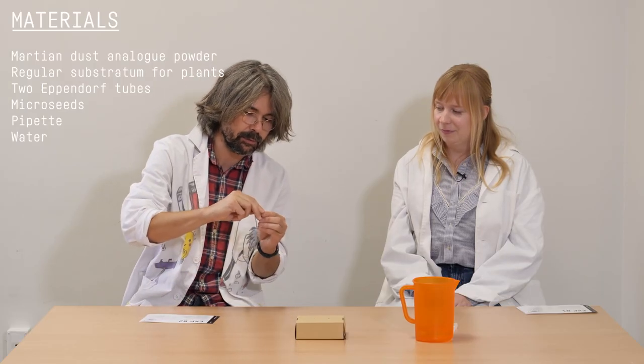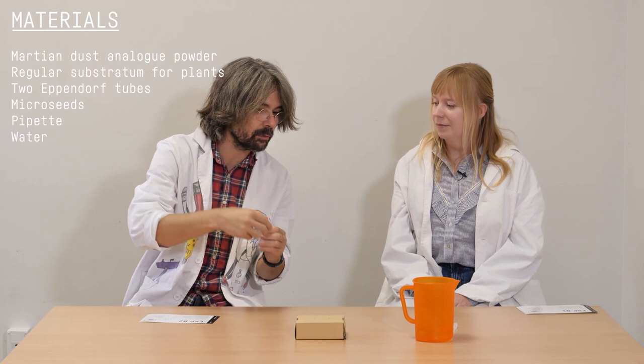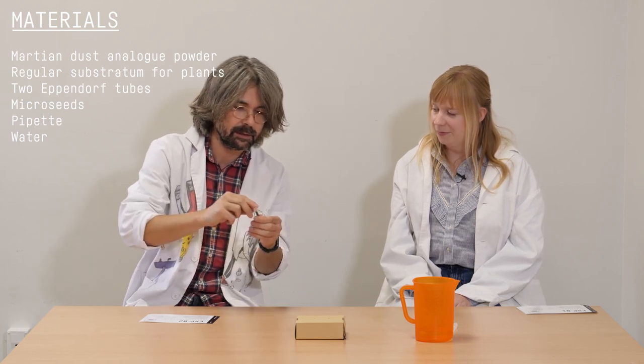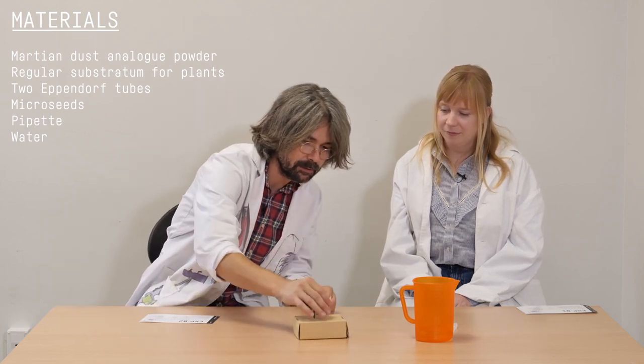And in each of them we have put small seeds, two or three seeds. We also need some water and we need a pipette. So what do you do next?